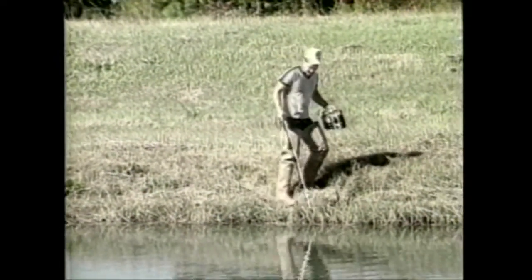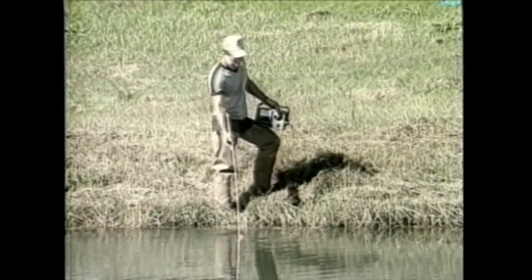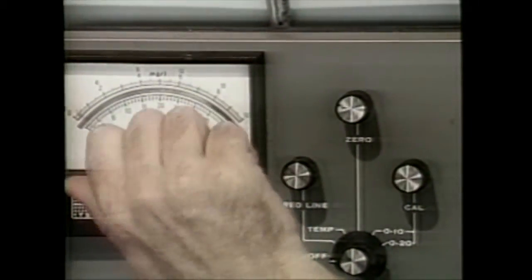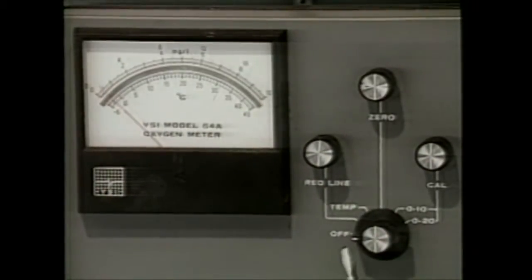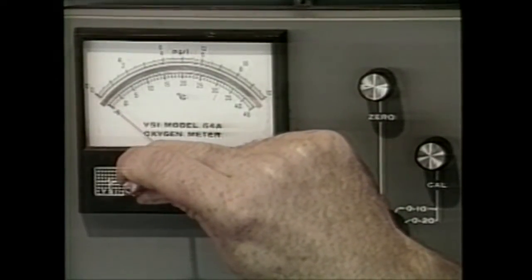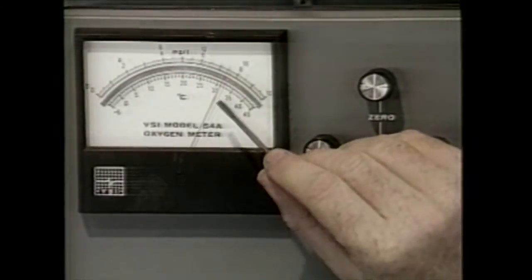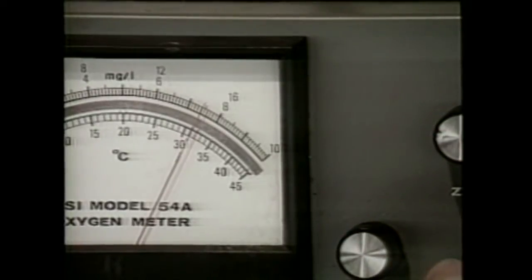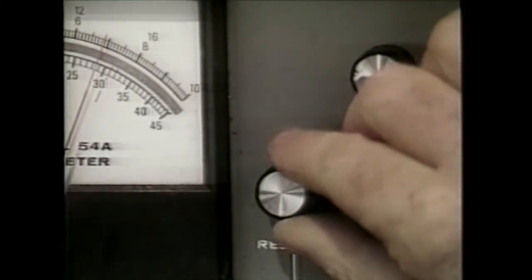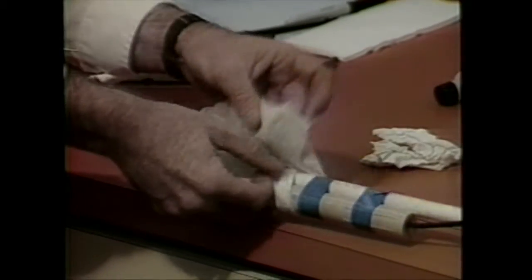There are generally two types of oxygen meters which are commonly used on commercial fish farms: temperature compensating and non-temperature compensating meters. They are both operated in basically the same manner, but with some differences. If necessary, adjust the needle to read zero by rotating the screw below the scale. If your meter has a red line knob, switch it to this position and adjust the knob so that the needle is directly over the red line. If this adjustment is not possible, it is a good sign that the meter's batteries are failing and should be recharged or replaced.